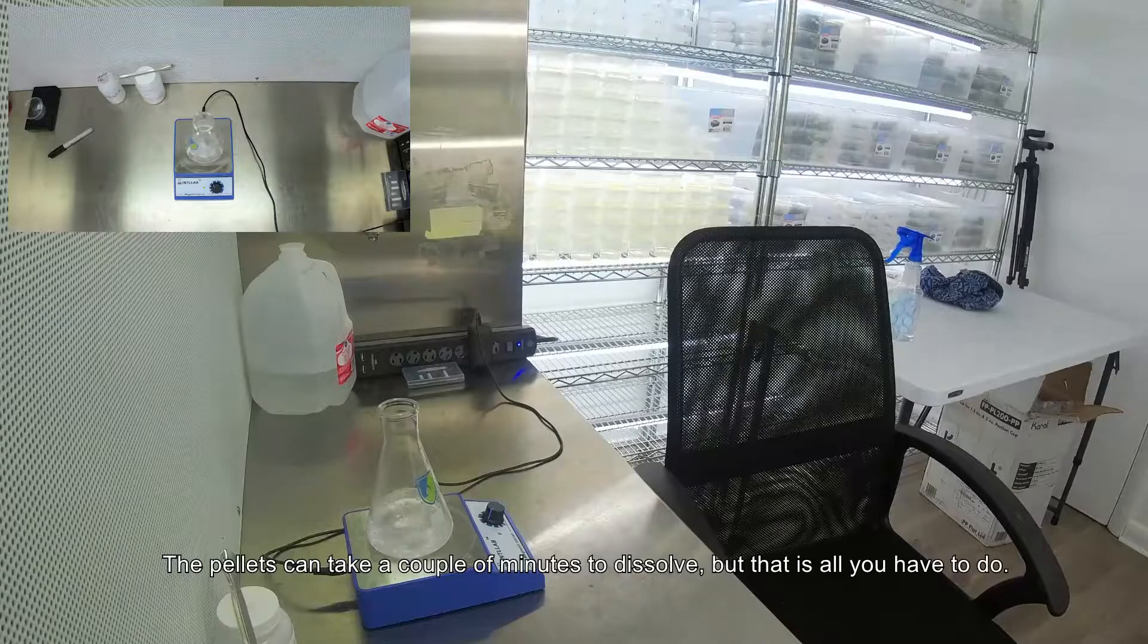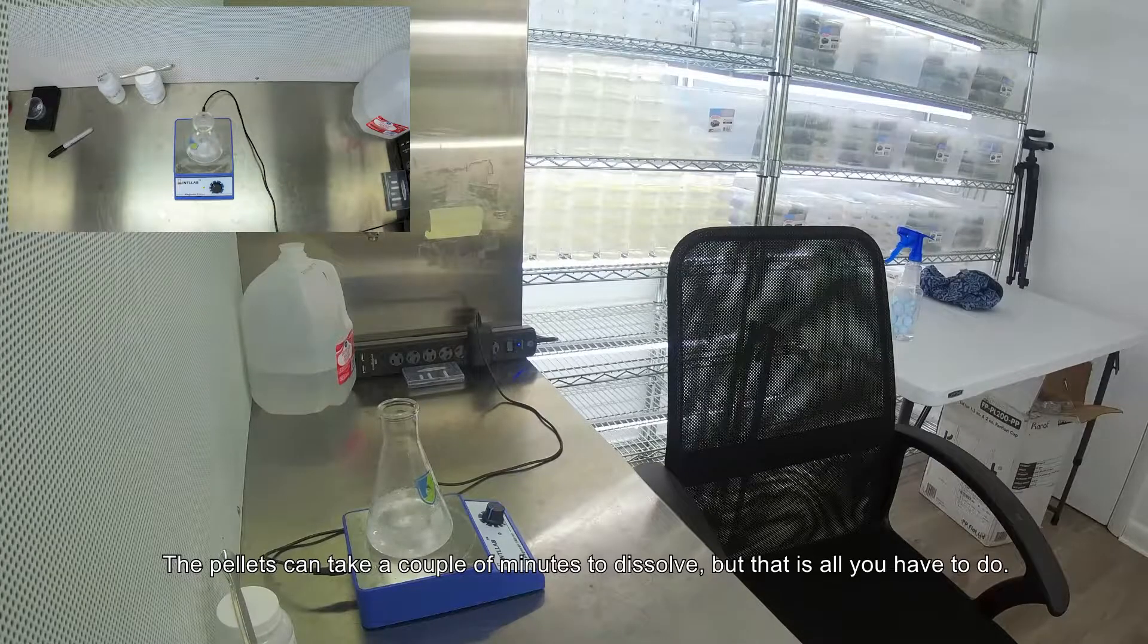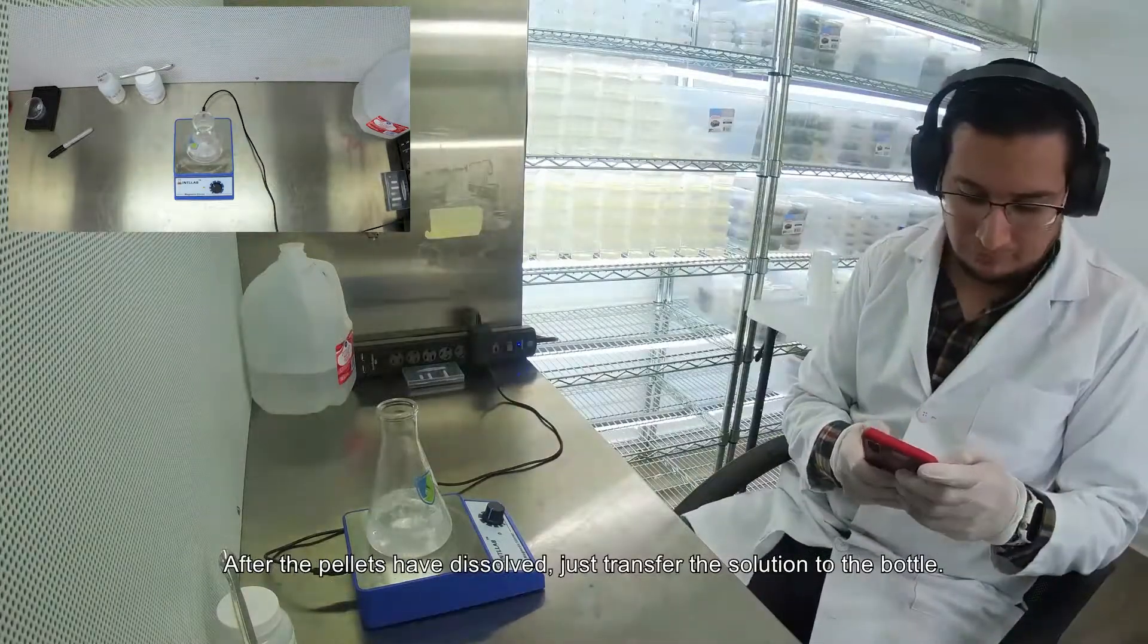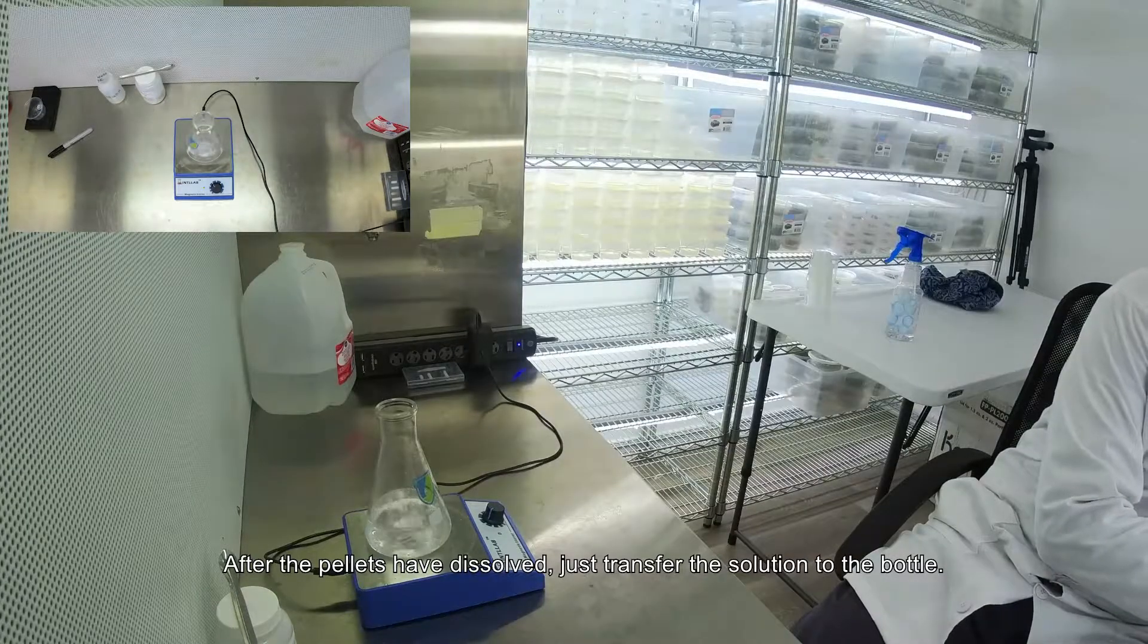The pellets can take a couple of minutes, but that is all you have to do. After the pellets have dissolved, just transfer the solution to the bottle.